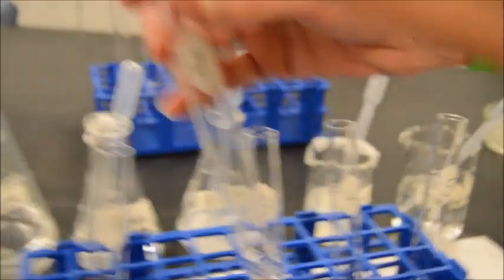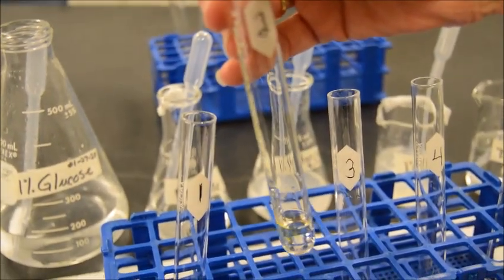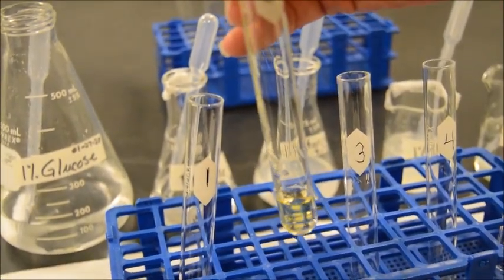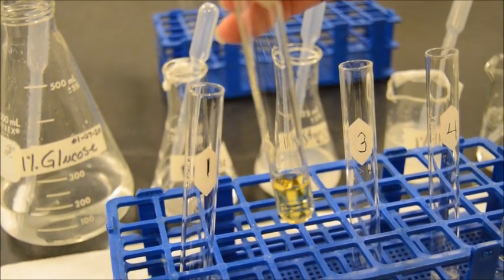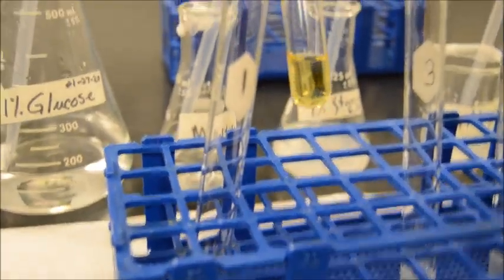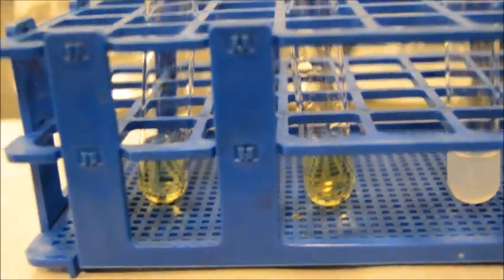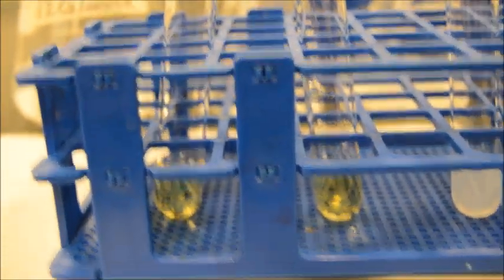Notice in this test, the color will change immediately. Here's test tube 3 with your 10 drops. We'll stir. This is maltose, which is a disaccharide, which is not starch, a polysaccharide. So this disaccharide stays a nice tea color, just like glucose. It's got to have multiple simple sugars, not just 2, in other words.